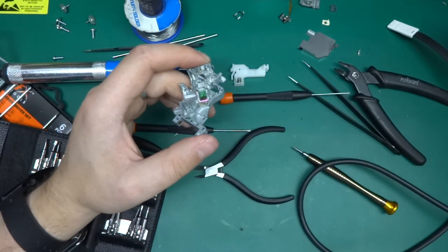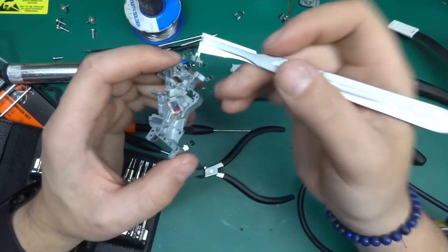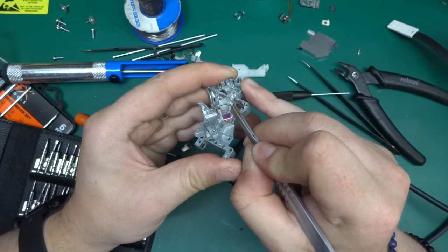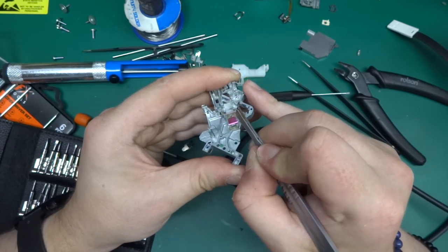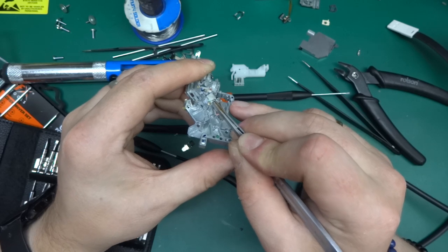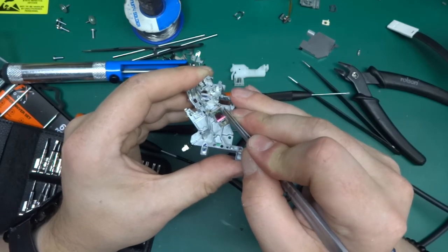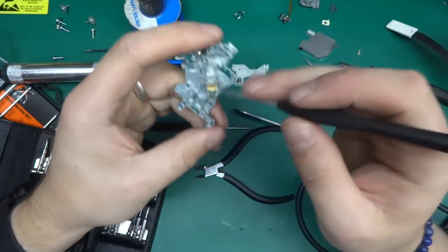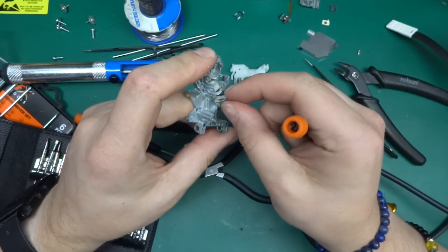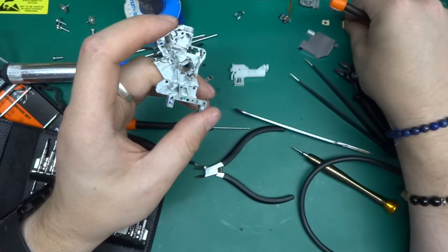But in general, the best way to do it is get something sharp, like I've got a broken scalpel here, and try to slice through the glue whenever you see glue. This will usually make it easier for things to pop out. Not always will you succeed in cutting all the way through it, but sometimes, well, every little helps, I guess. There we go. We've got a filter, another one.